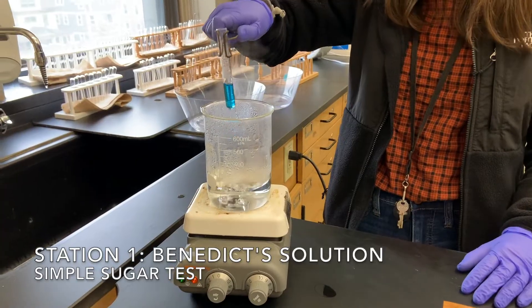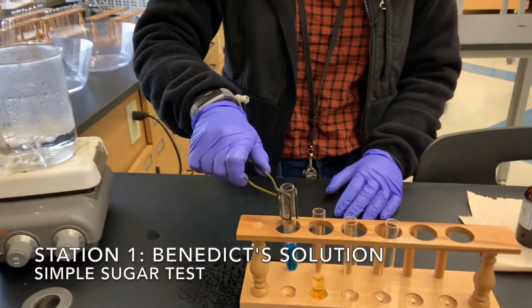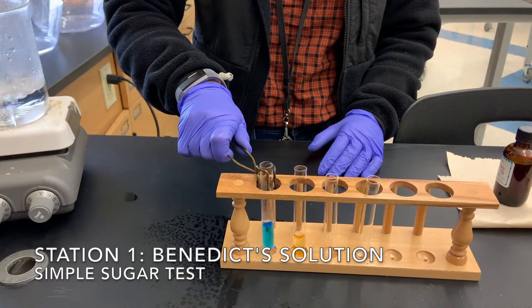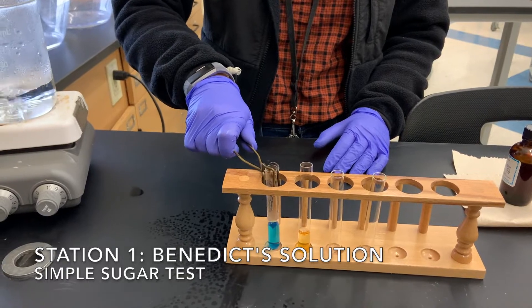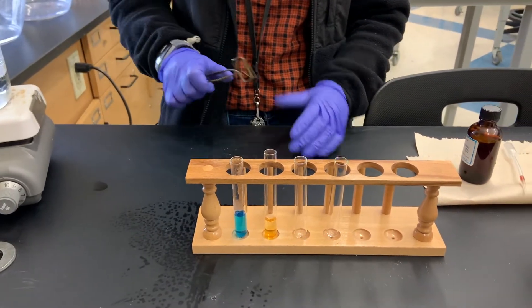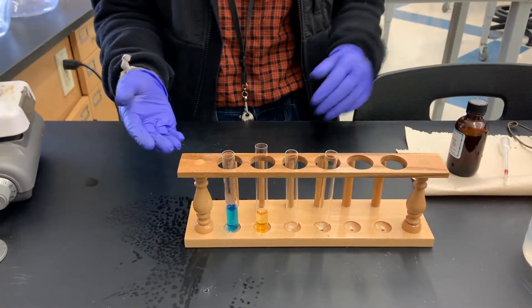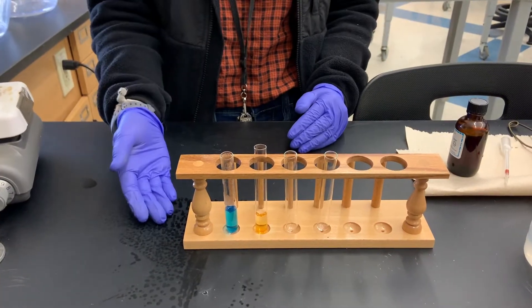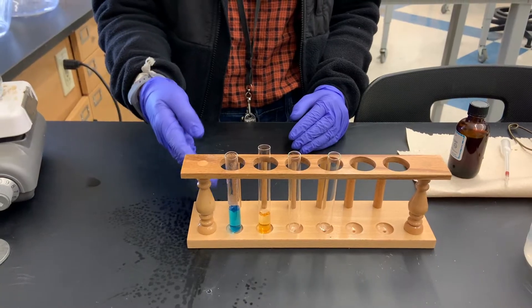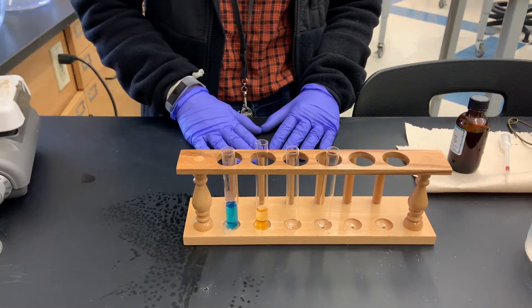Now that the solution has been in the water bath for three minutes, it's ready to come out. We place it in the test tube rack very gently. We see that it is still blue, so that means the reaction didn't occur and there are no simple sugars in our water, which is what we expect from our control.